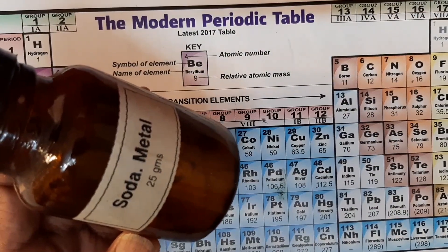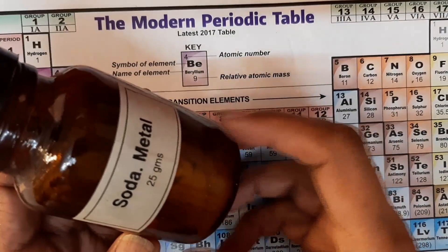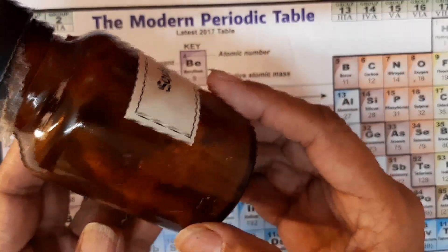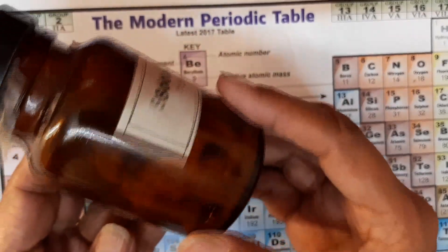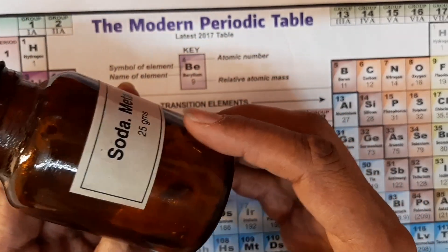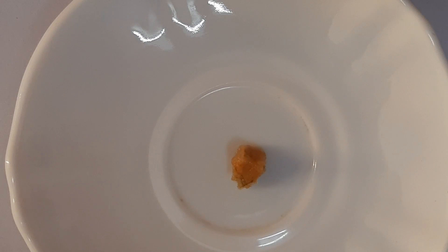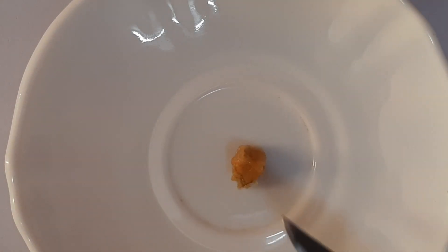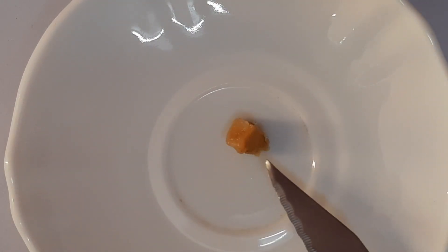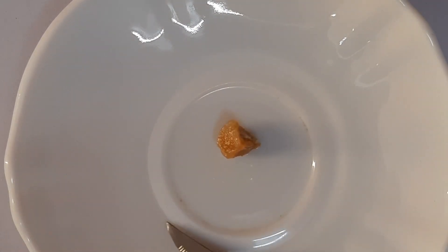Therefore it is stored in kerosene. Here you can see sodium metal stored in a dark brown glass bottle in kerosene. You can see the pieces of metal and the kerosene liquid. Here is a piece of sodium metal — as you can see it is still wet with kerosene, and now I am going to dry it nicely.